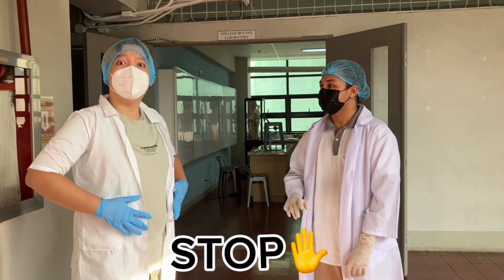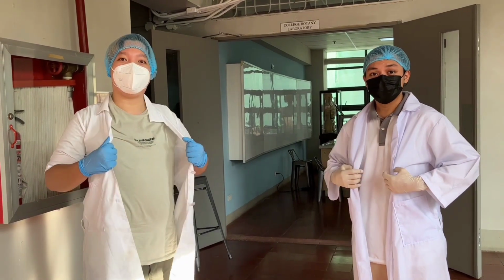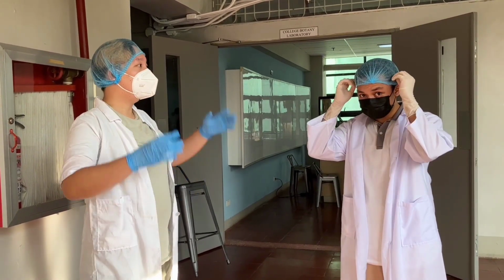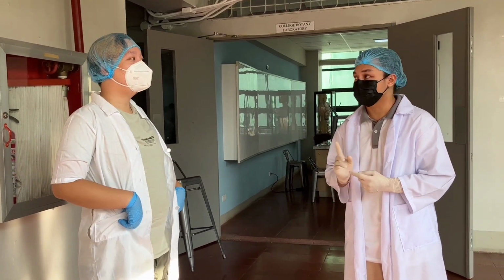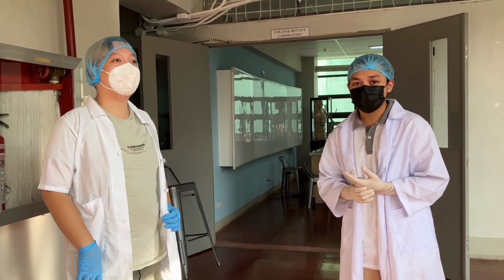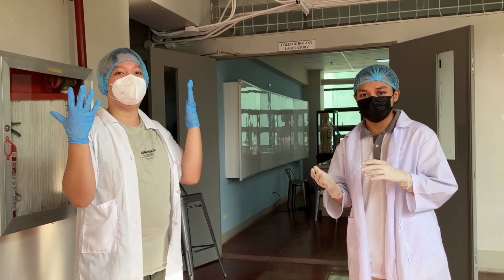Stop! Oh, hi partner. So first, before we enter the laboratory, here are the things we need to ensure. First, our lab gown. Why? To protect us from the direct contact from the chemicals we will be using in the laboratory. Next, our hairnets, to avoid hair follicles from falling in our experiments. Third, our face mask, to avoid saliva or spit or sneezes getting into our experiments.